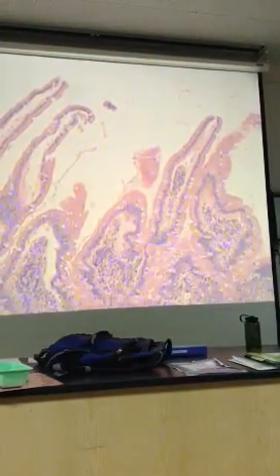Okay. So what kind of tissue is this? Not pointing to the blood vessel, but just the general tissue. Areolar? Yeah, that's areolar tissue, and that's called the lamina propria, all inside the villi, continues down here. This is the areolar tissue. This is the lamina propria. Okay, I probably should back up now. I'm a little too close. But that was cool to see it that close.